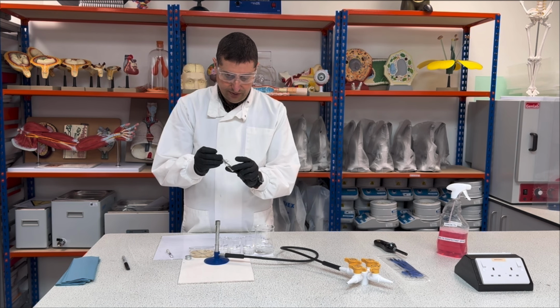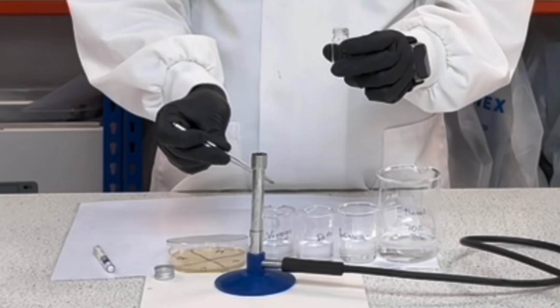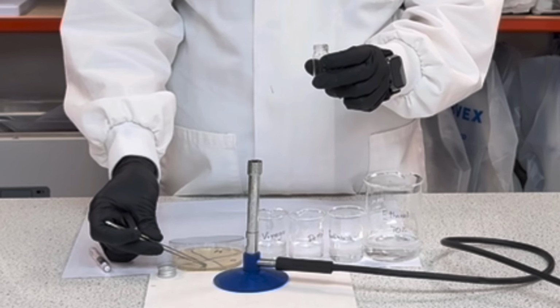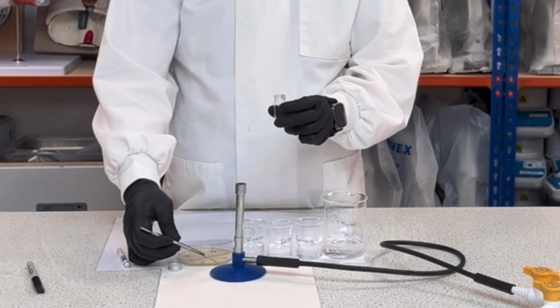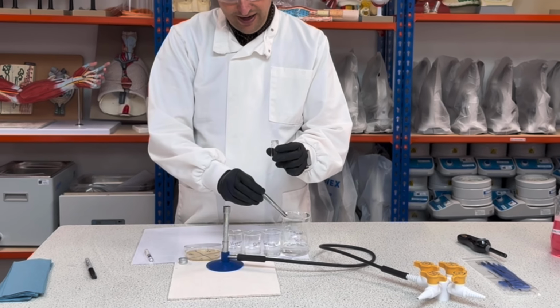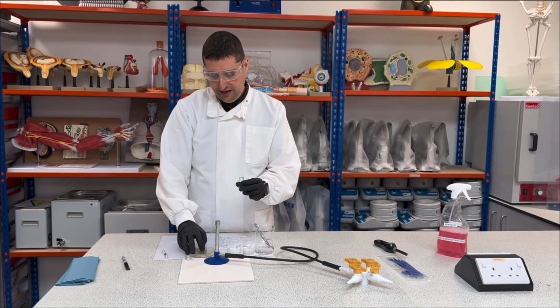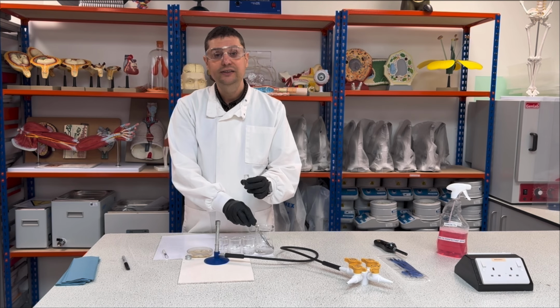So I will collect 1 disc, place inside the vinegar, remove the excess, and place here in the middle of the V. And I will press a little down and put this back in the ethanol. Then I will close and I will rotate for D. Same procedure.